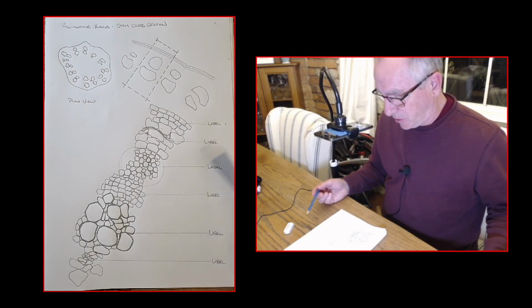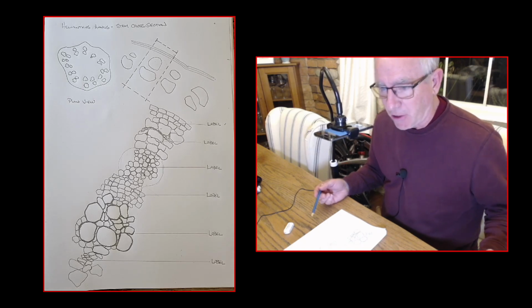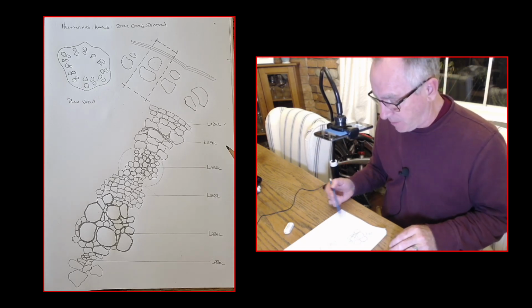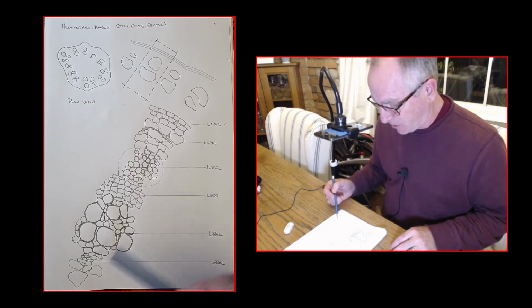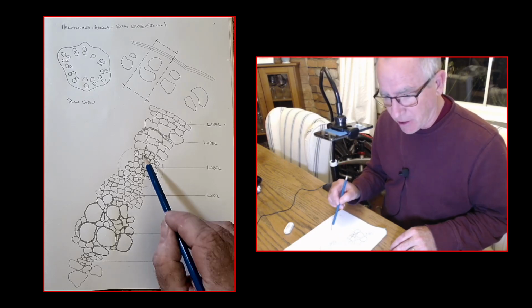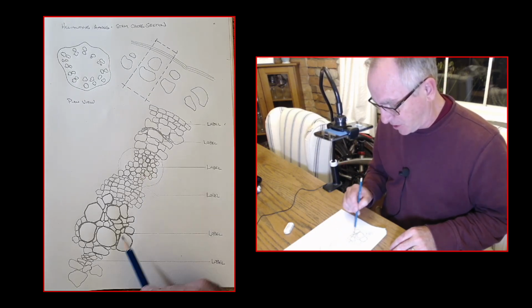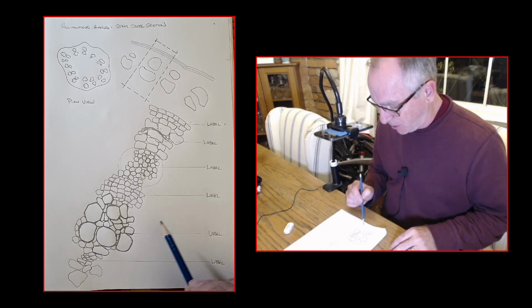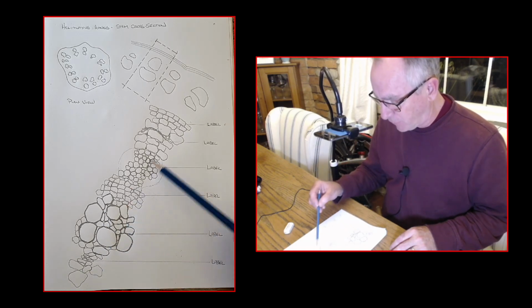That took me about 20 minutes. And it's no Michelangelo, let's say, but it's not bad. I mean, I would give it very good marks. For me, I'm quite proud of myself. You can see that there are little circles in there because there are little tiny cells in the image. If you look at them carefully, I've indicated thicker cell walls in some and thinner cell walls in others. It's just a continuity which shows all of the different cell types.